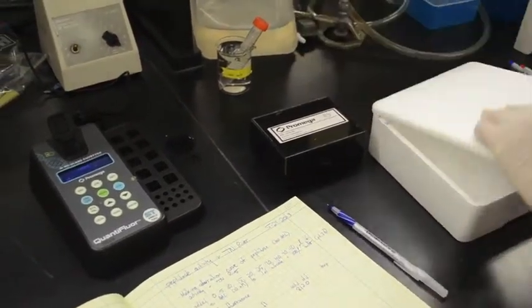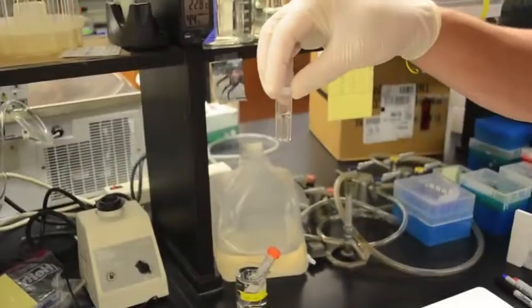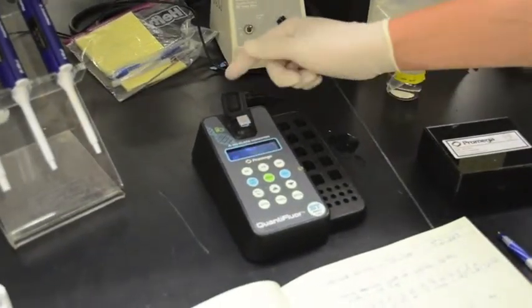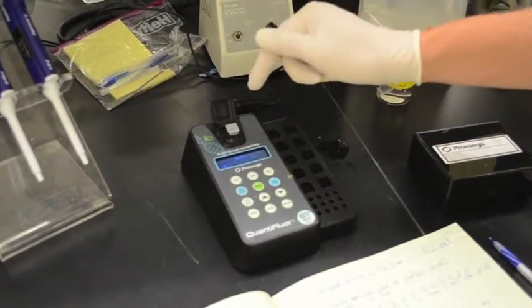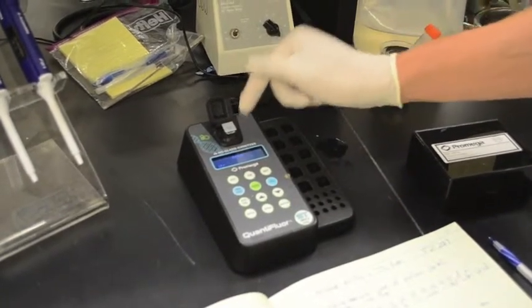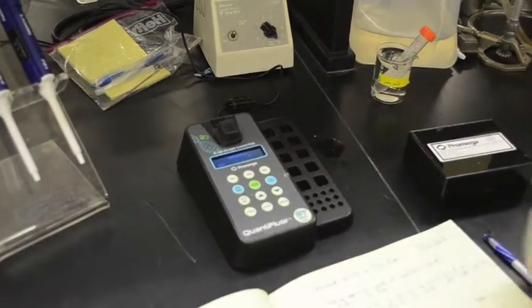We try to keep them in the dark the rest of the time. We line up the cuvette like this so that the flat side is facing towards us and the indented sides are on the sides. Put it down firmly into the fluorimeter, but again, don't force anything. One really important thing is we don't want to get any liquid into the cuvette cavity where the fluorescence is read, because that'll cause all kinds of problems. Close up the top and press read.